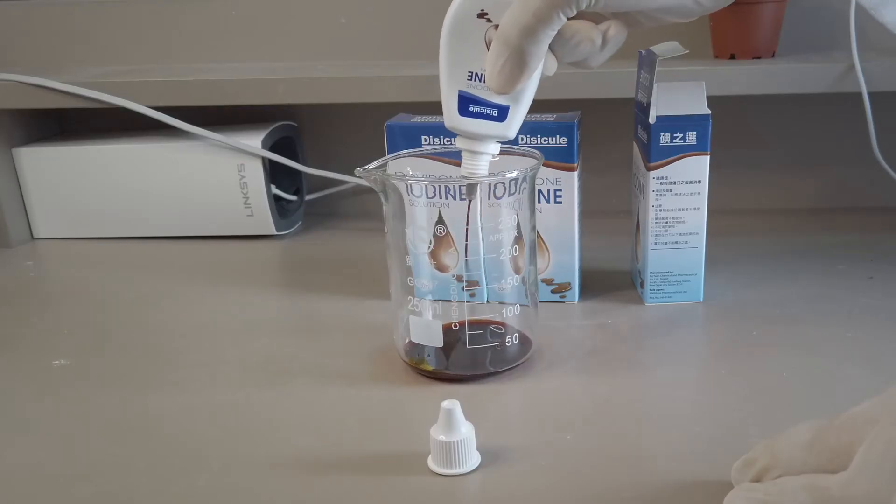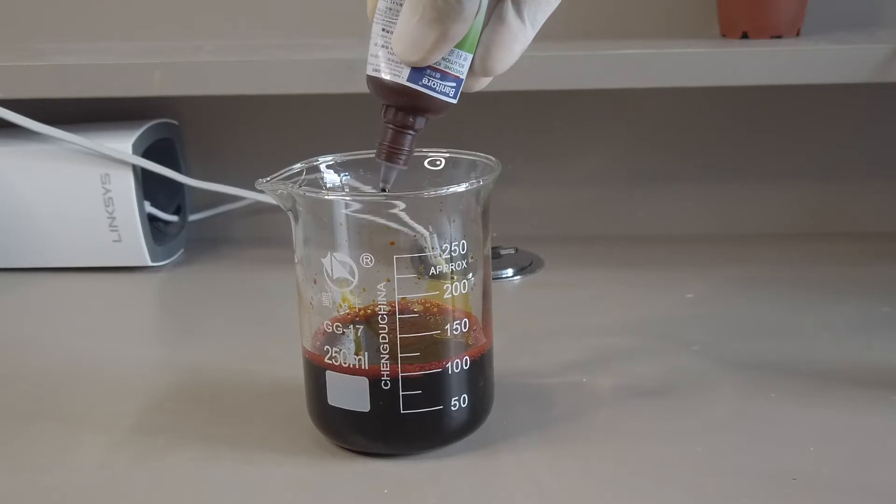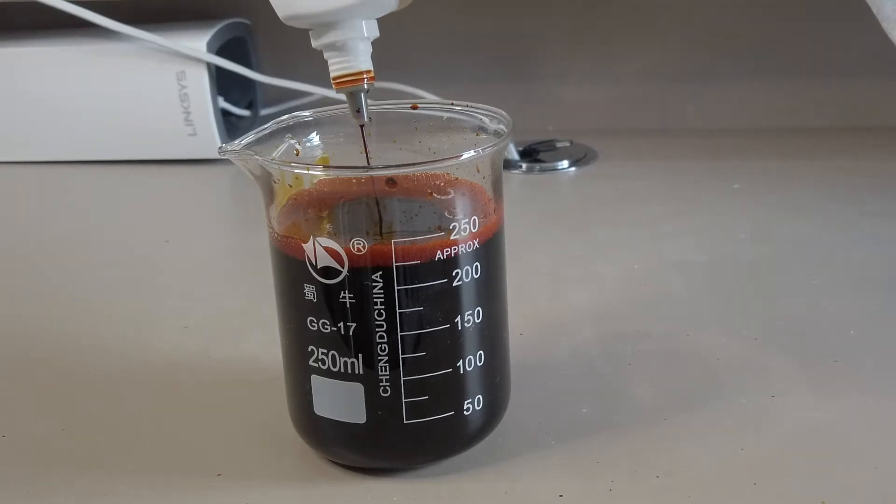We've got a few bottles of povidone iodine from a local drugstore. It really cost us quite a fortune and this is how much we've managed to gather.